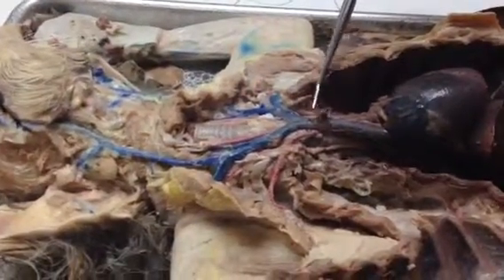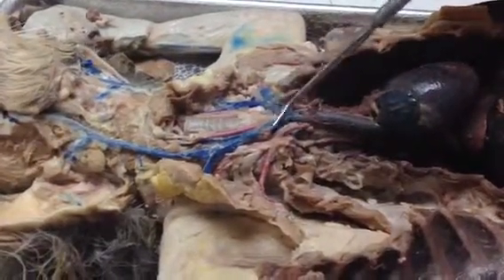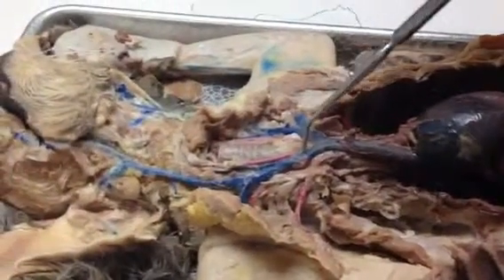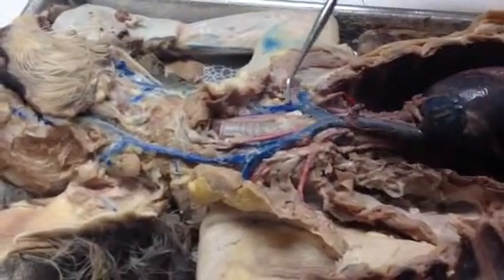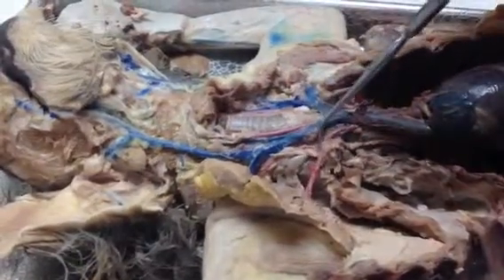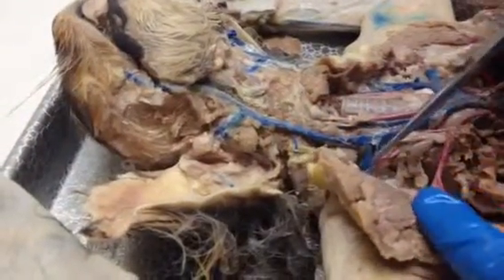All right, and then from the anterior vena cava, we're going to get a branch, and this branch is called the brachiocephalic vein. And from the brachiocephalic vein, on both sides, we're going to go into the subclavian vein and the external jugular vein. Okay, so here it is on the left, and on the right, we definitely see the external. And it's a little bit hard to see. Is the subclavian gone? I'm thinking the subclavian is gone. Does it go over to here? Look at the branches right there. Oh, it goes way up there. Yeah, okay, that's a high one.